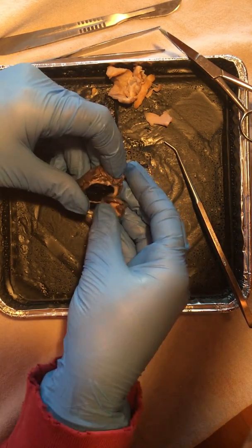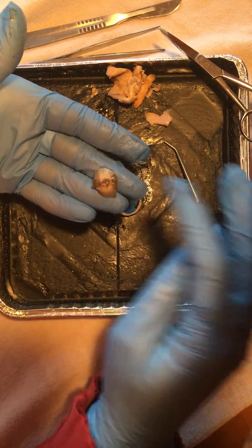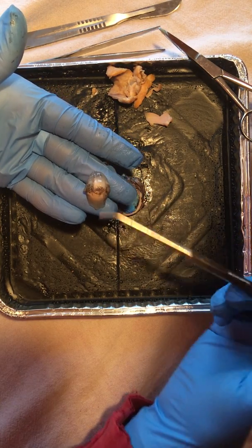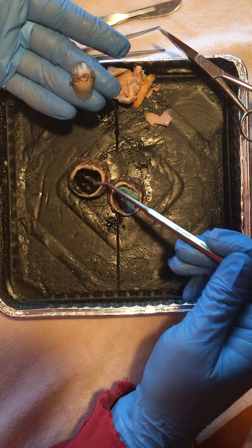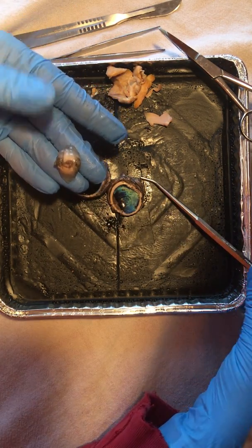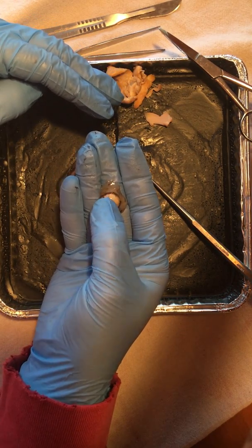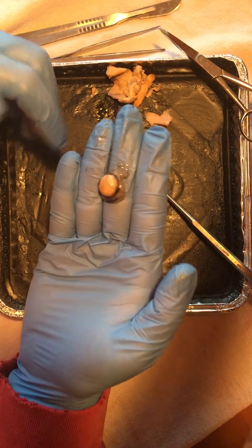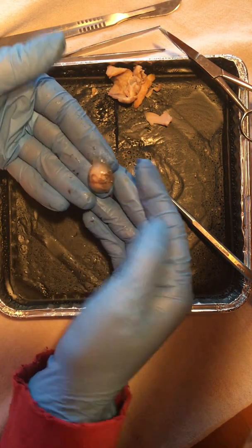And so once we look on the anterior portion here, you'll notice the lens is surrounded by a pretty gelatinous tissue, and that is called the vitreous humor. It's very gelatinous, helps maintain the shape of the eyeball as well, and that's found here in the vitreous body. That's a cavity between the retina and the back of the lens, and that holds the lens, which is a very tough, hard structure. It's the one structure where it's pure protein fibers. And in my research, I found that it's the only part of the body that is not susceptible to cancer. So that's a pretty interesting little tidbit there as well.